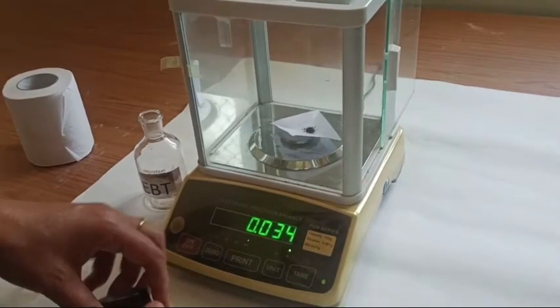Here I would like to suggest you to first transfer this sample to the reagent water, and then weigh your paper again. Since some of the particles of this reagent attach to this paper, you will get the actual weight after subtracting 0.034 minus the weight of that paper after transferring the sample to the reagent water. Only then you will know how much weight of the sample you have transferred to the reagent water. Otherwise you will think that you transferred 0.034 to the reagent water and you will calculate the concentration corresponding to this weight. But here you do not know how much sample is stuck on this white paper.